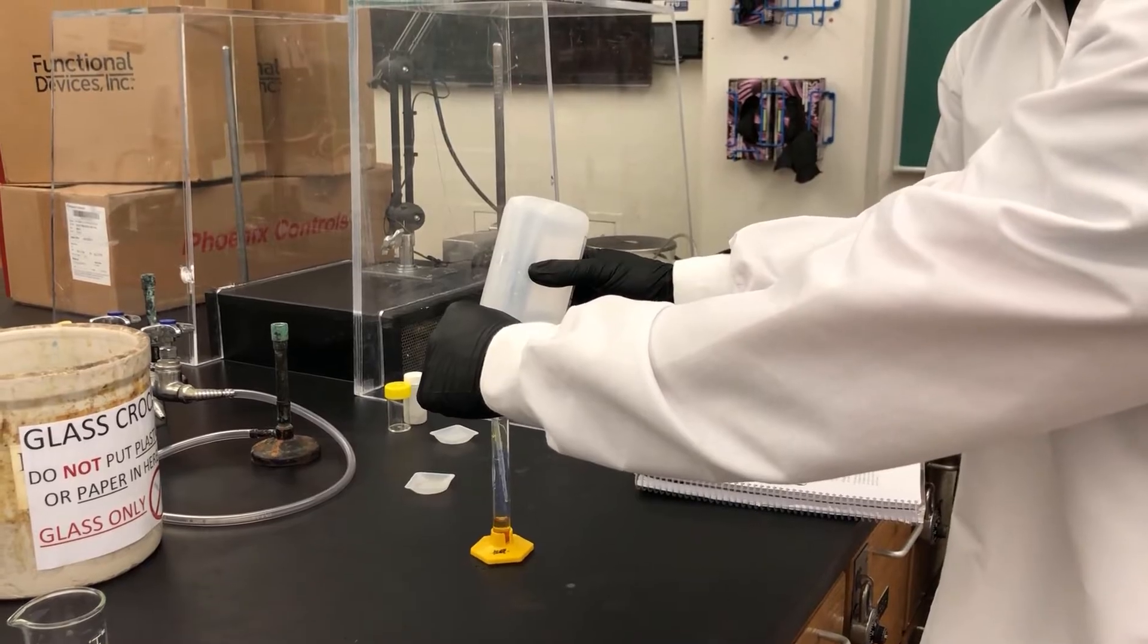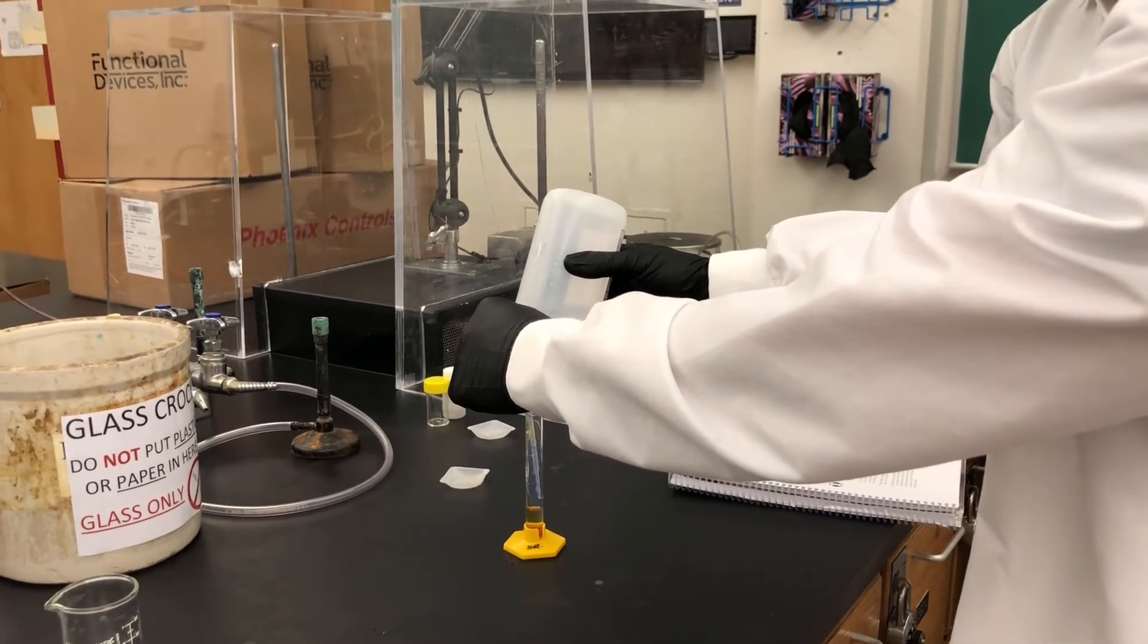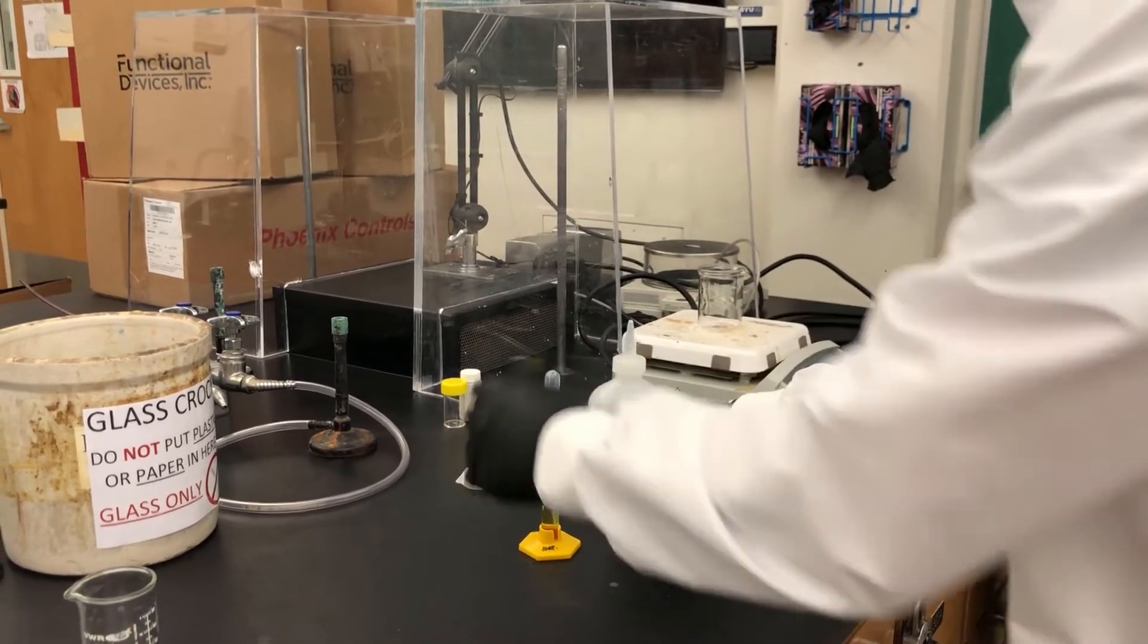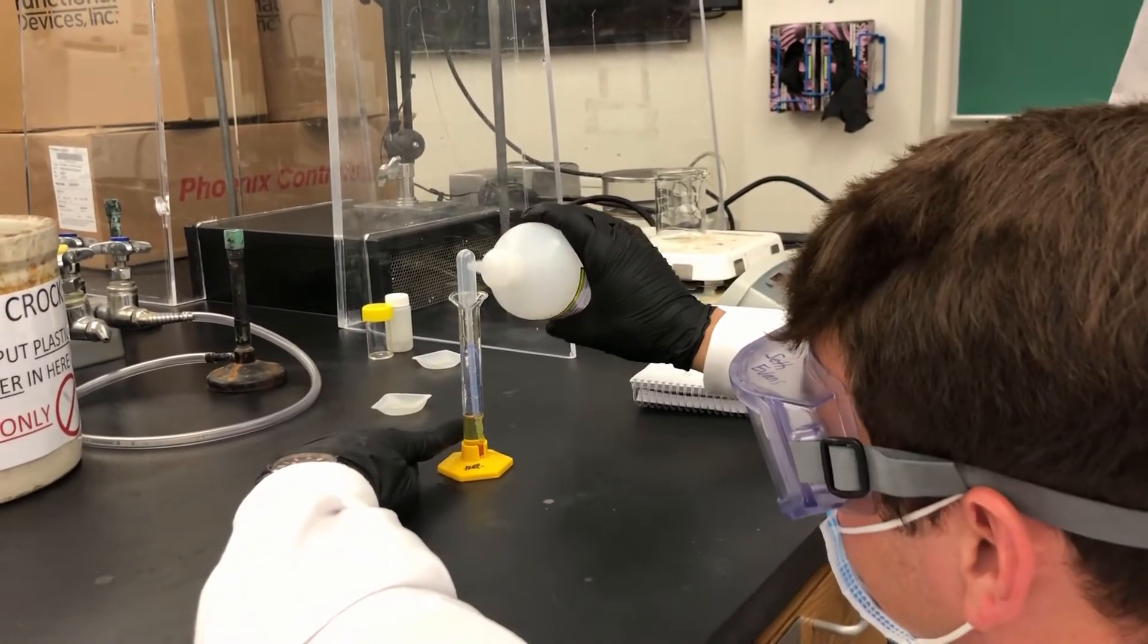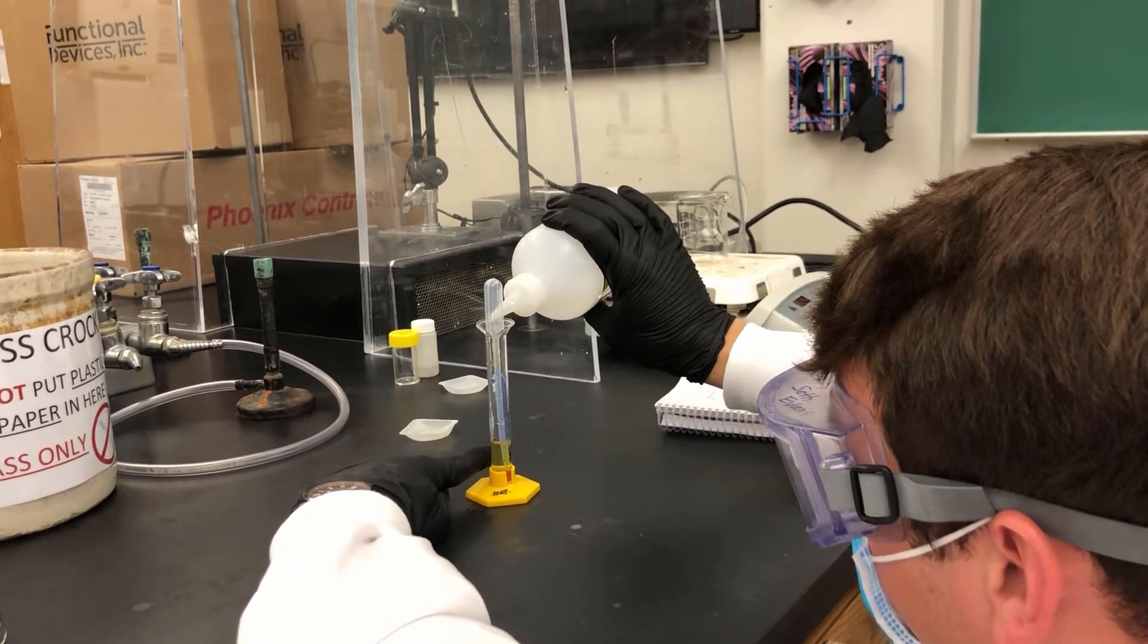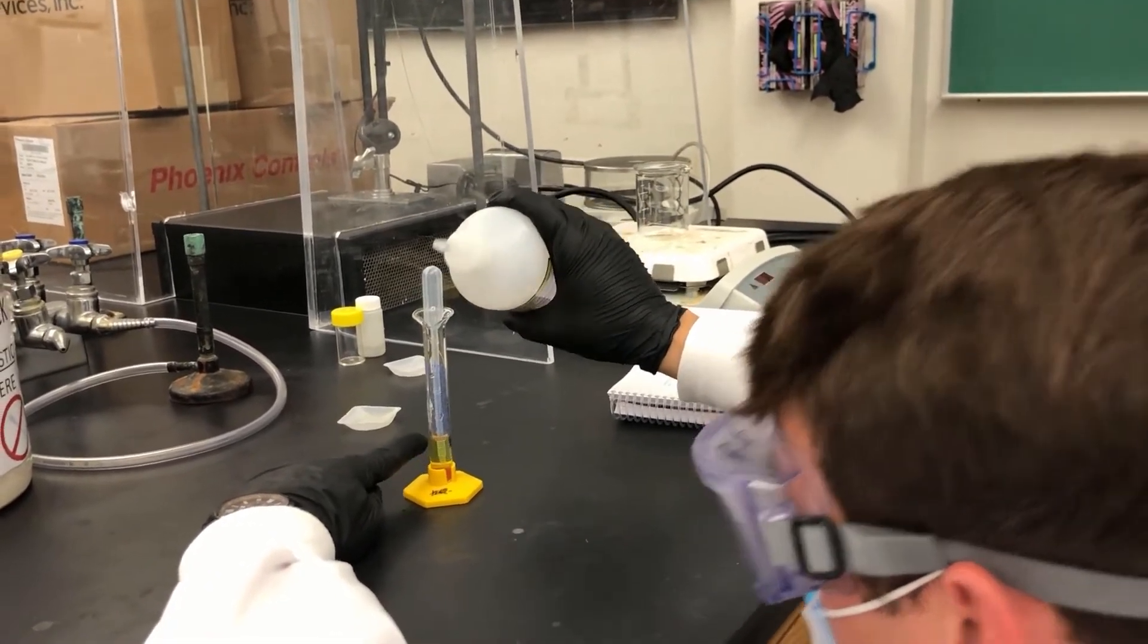So we're going to watch this carefully. Putting my finger behind the meniscus, underneath it. Perfect.